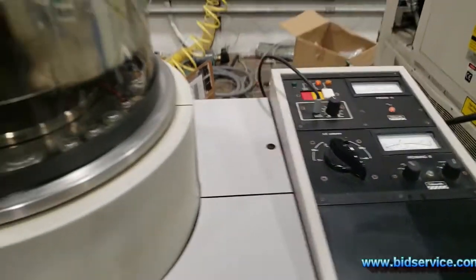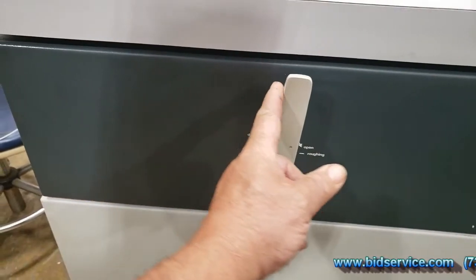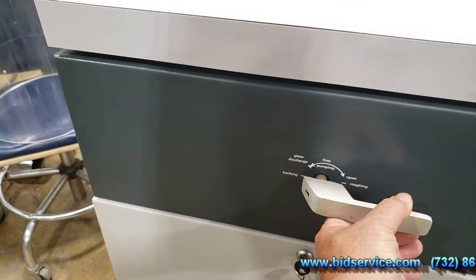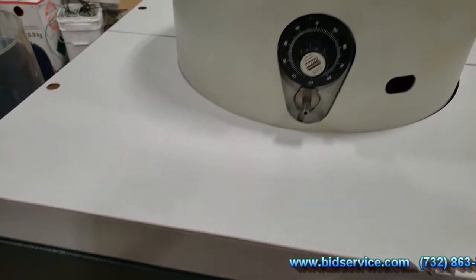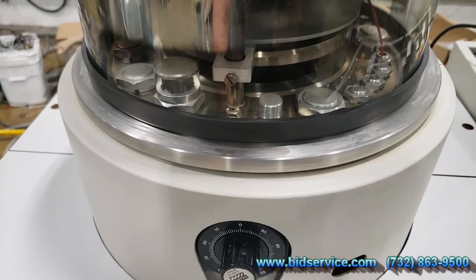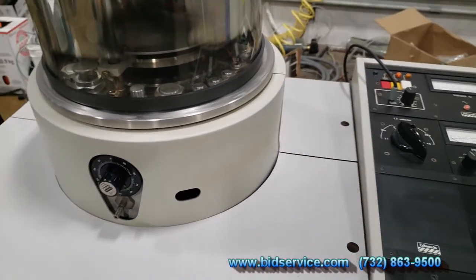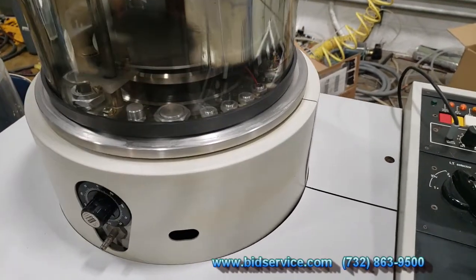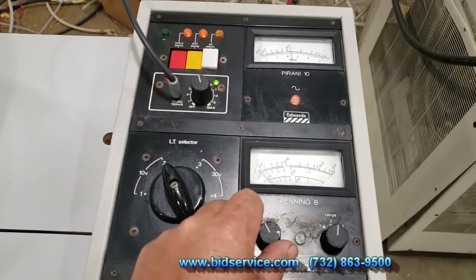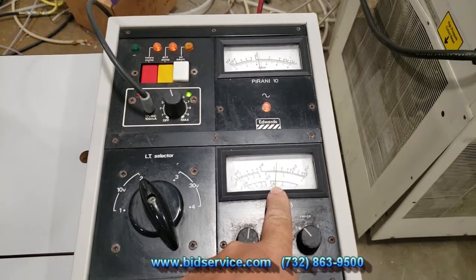So we're pretty close. What we're going to do now is turn this knob to closing, go to the backing again, and then this is going to pop out. You can see we slowly open it and the poppet valve comes out. If the poppet valve doesn't come up, that means you didn't pump it down enough. So now it's under high vac again. If you look at your gauge here, even though it's up there, it's going to start pumping down. Turn this on, put this on range one — you can see right there that it's starting to pump down.